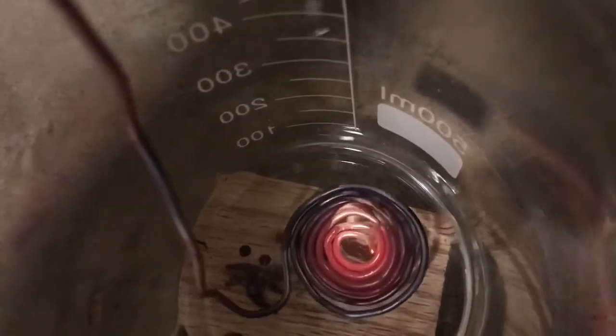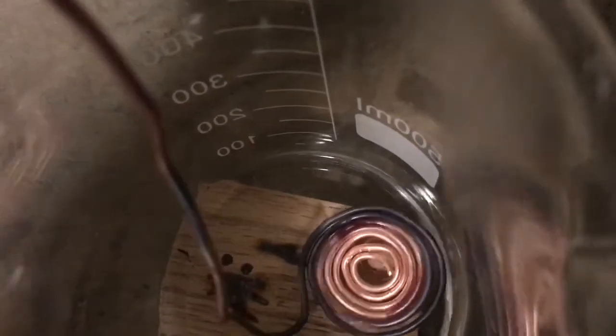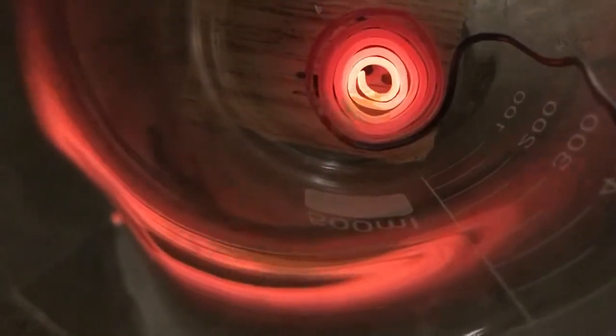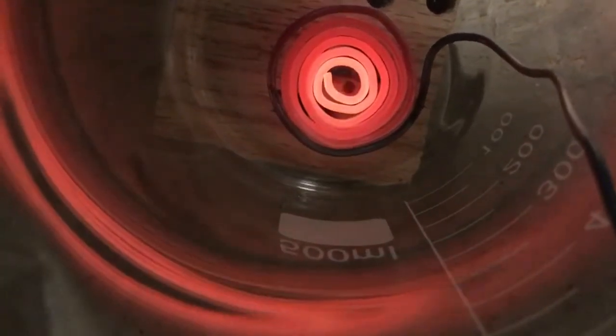The same thing happens with acetone. We'll do that next. Now using regular acetone, you can see waves of oxidation and reduction of the catalytic copper surface, and it's staying hot.